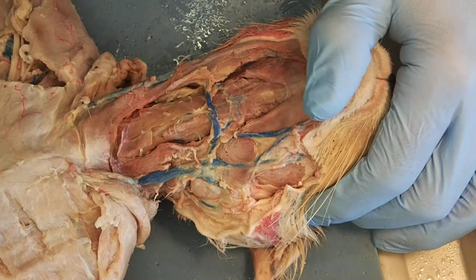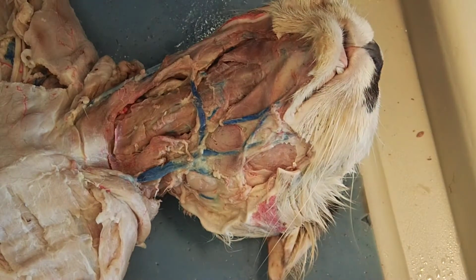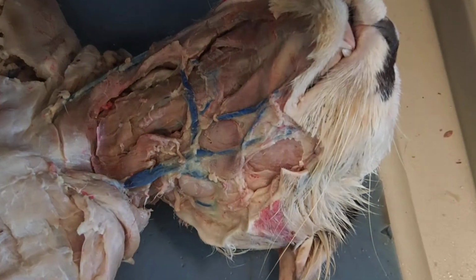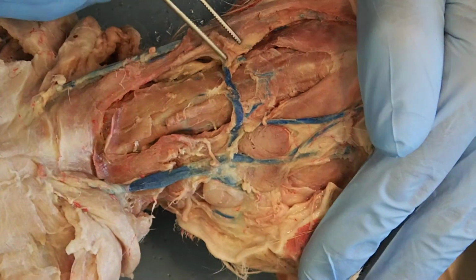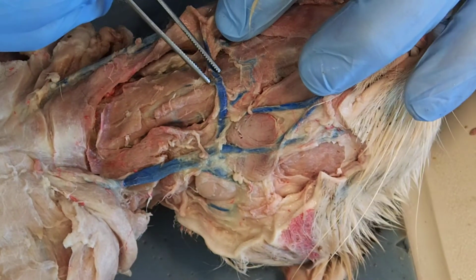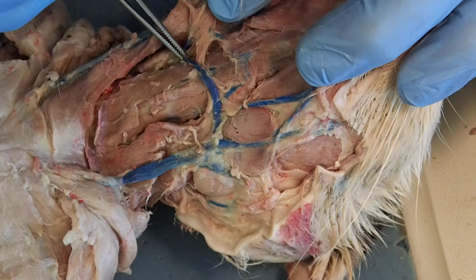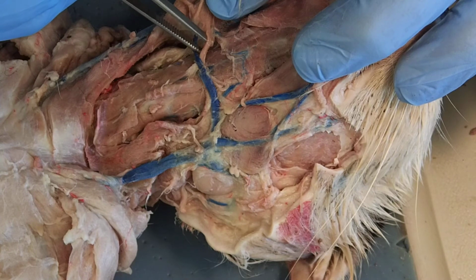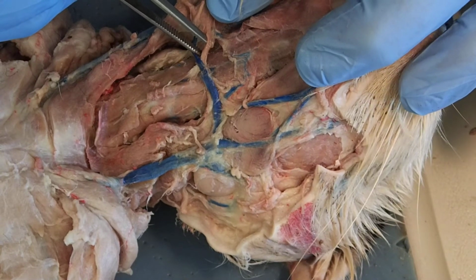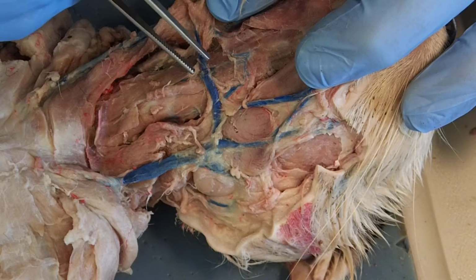Okay? There's another muscle. Let's see if we can do this. Zoom you in even further. That sits below this transverse vein. You see it right there? It's this one. Moving it out with my forceps from underneath the transverse vein. It's running from the side, the lateral side, to the middle.